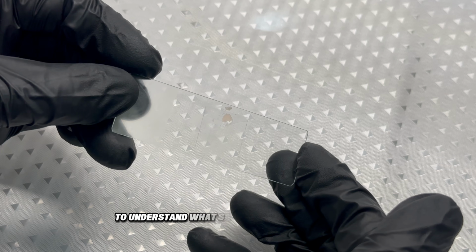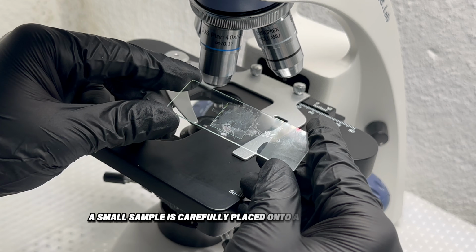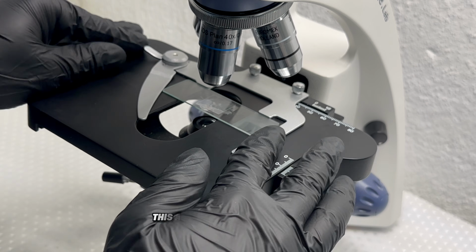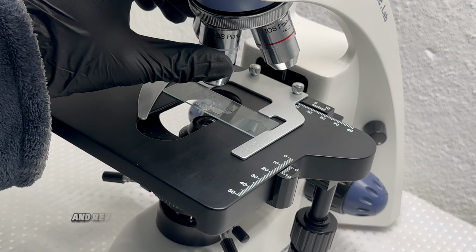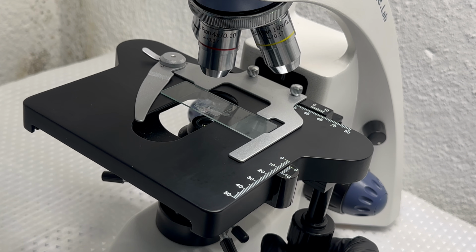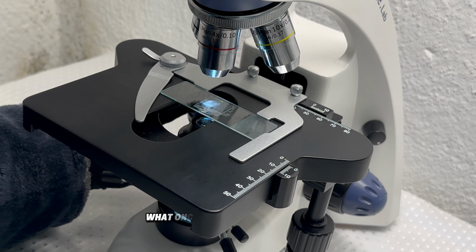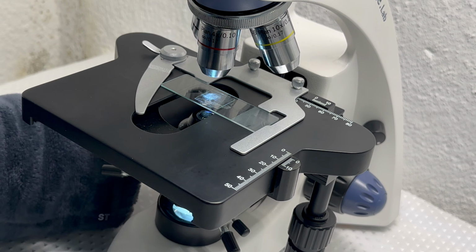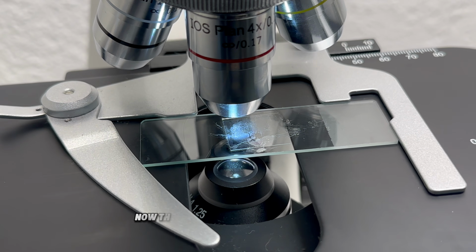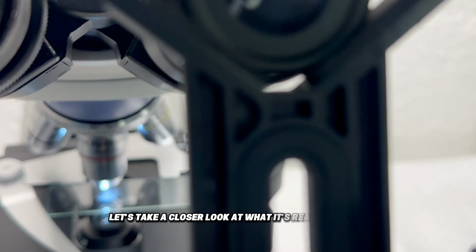To understand what sausage actually looks like, a small sample is carefully placed onto a microscope slide and pressed into a thin layer. This allows light to pass through and reveals details that are completely invisible at normal scale. At this point, the product begins to change. What once looked smooth and simple starts to break apart into something far more complex. Now the sausage is under the microscope. Let's take a closer look at what it's really made of.